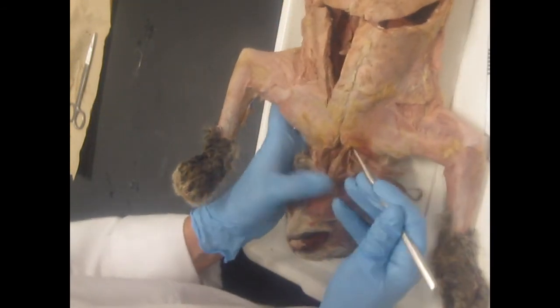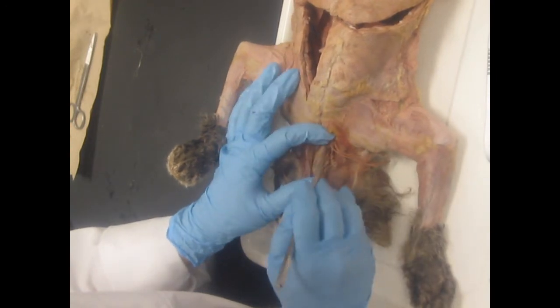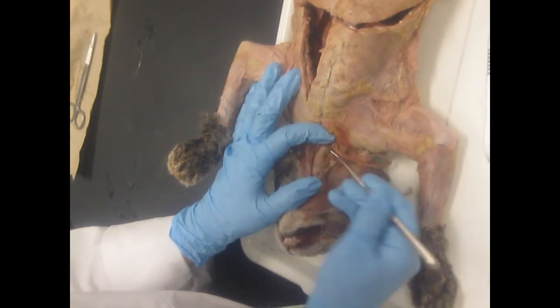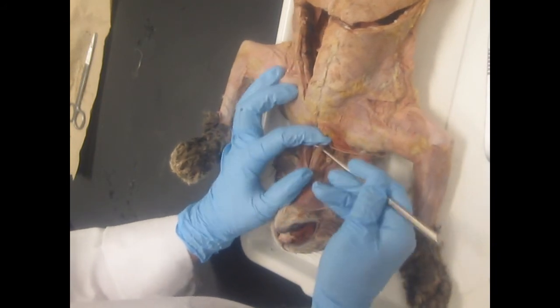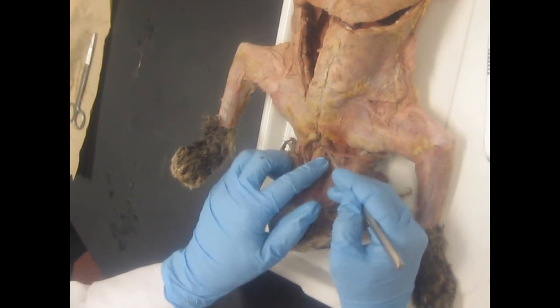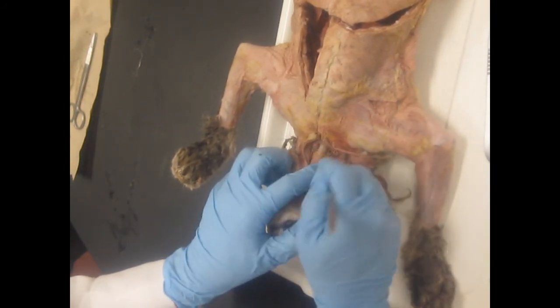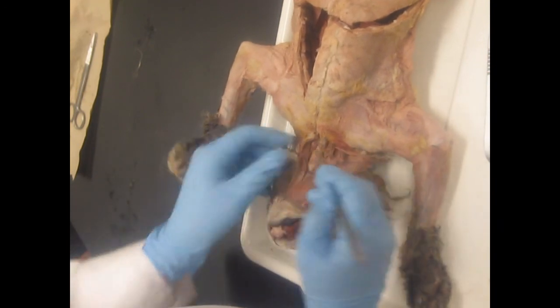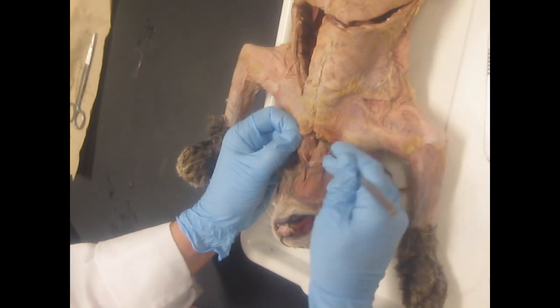Now we can try finding it on the other side. Oftentimes it's also a little dried up too because it's been exposed because of that incision that they make. And it's exactly what I've got over here. I've kind of got a raisin looking damaged thyroid gland over here. Okay. Alright, so we've got a really nice one on the left. Please try to at least find that for your points.